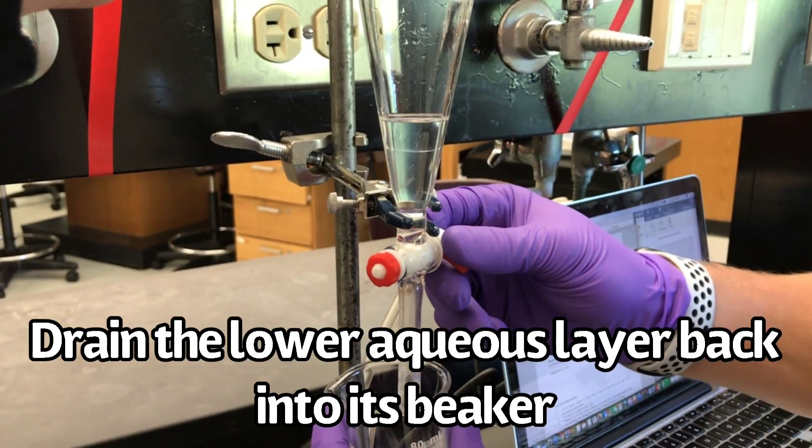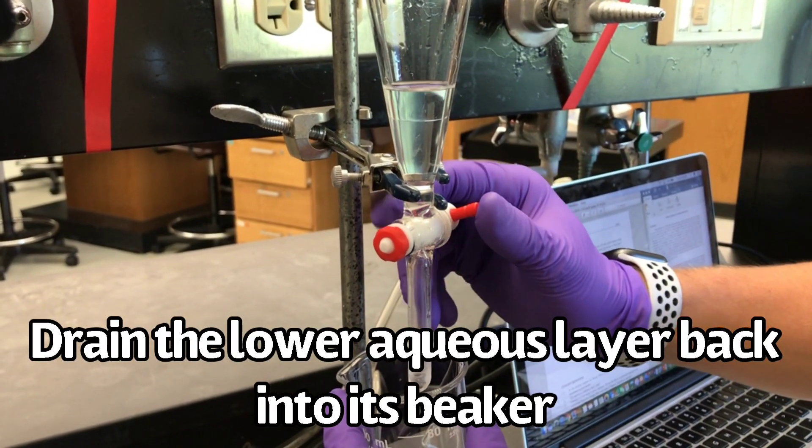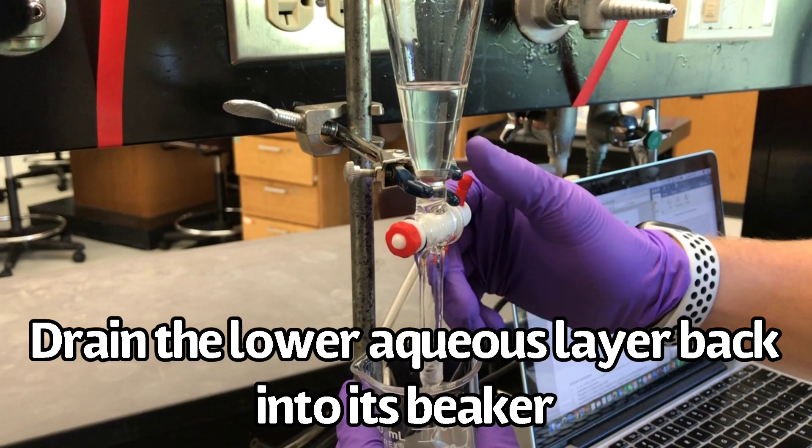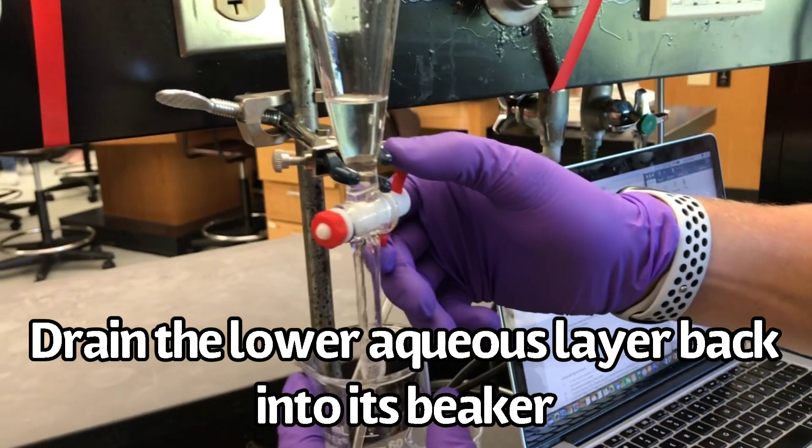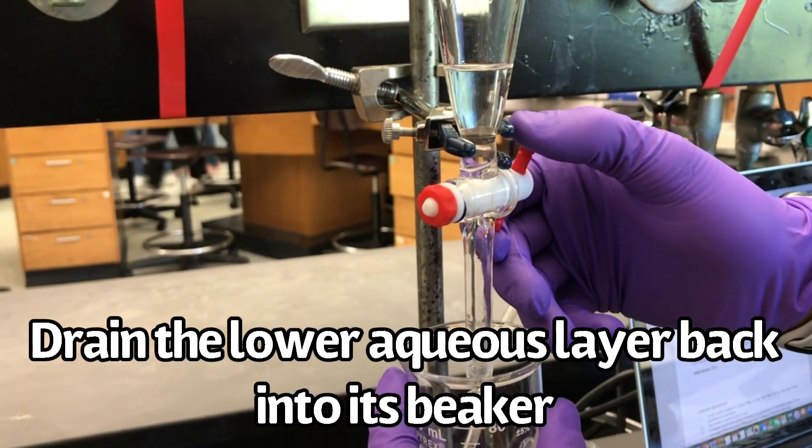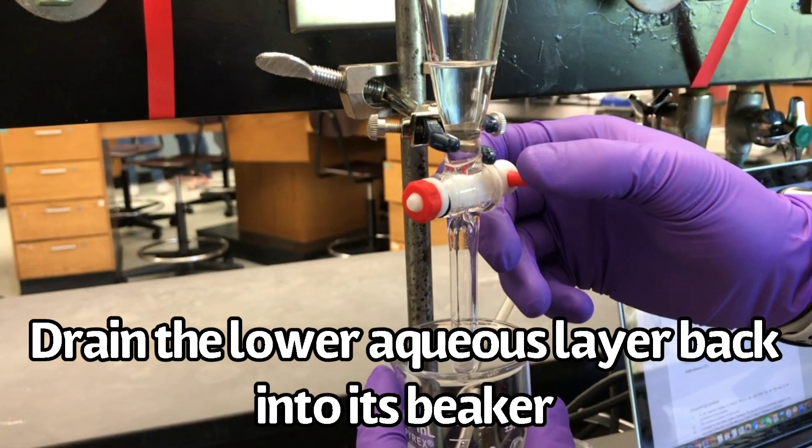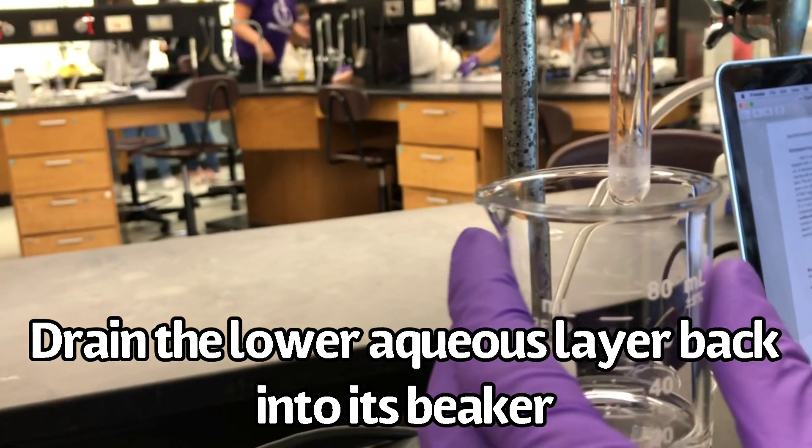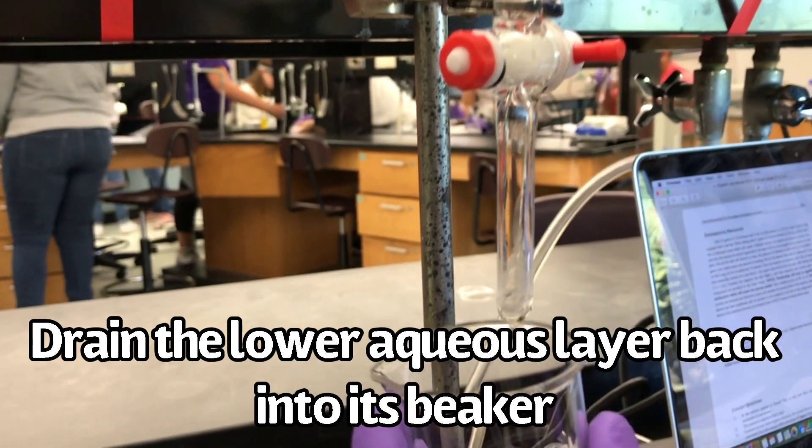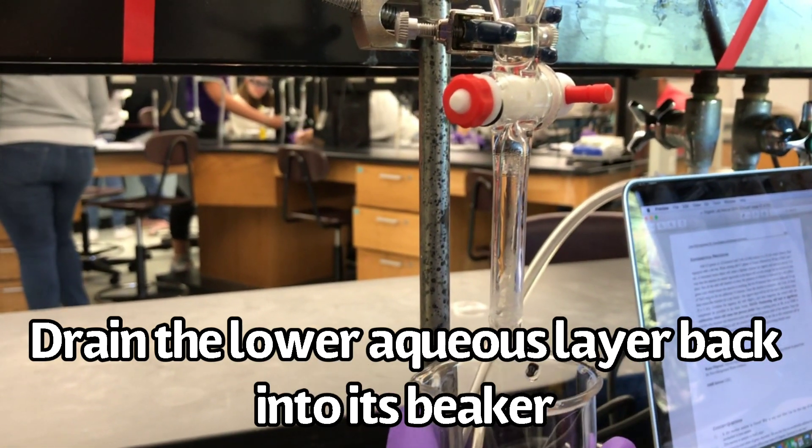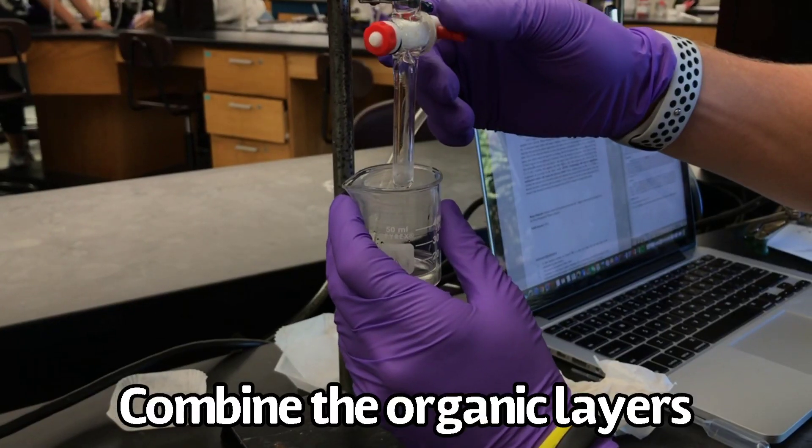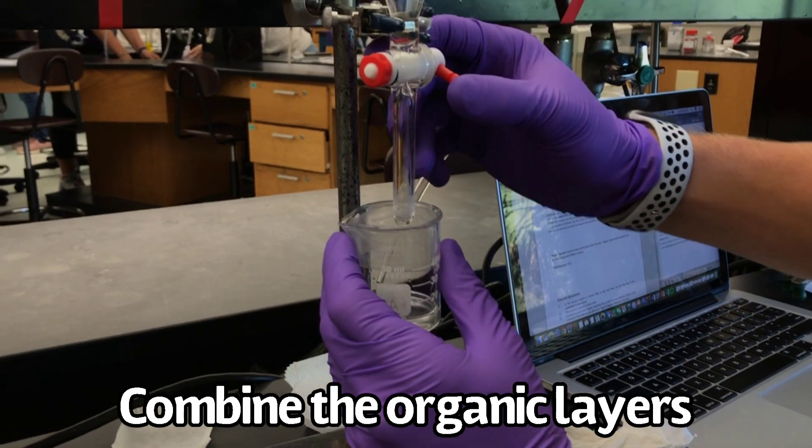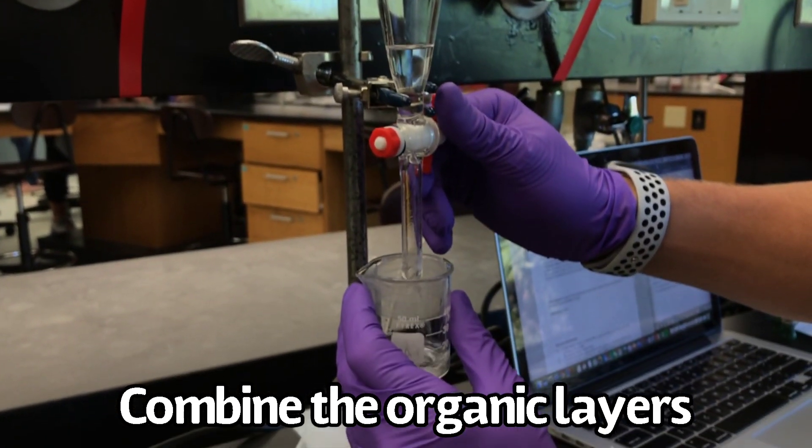Drain the lower aqueous layer back into its beaker. Next, combine your top organic layer with your previous organic layer.